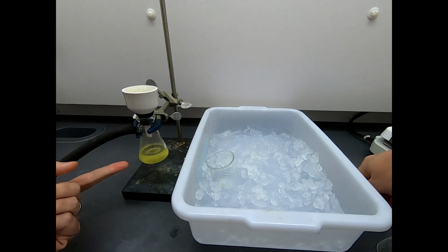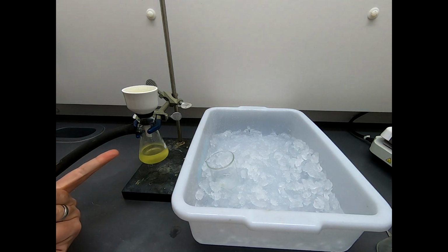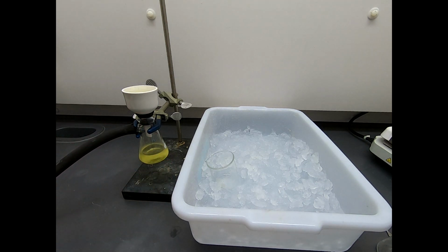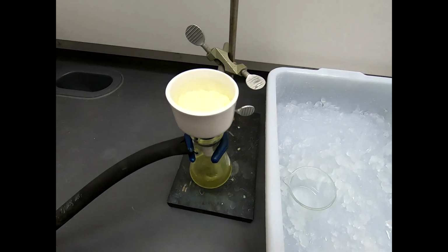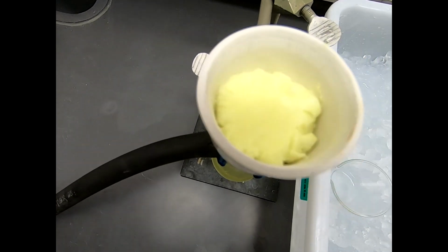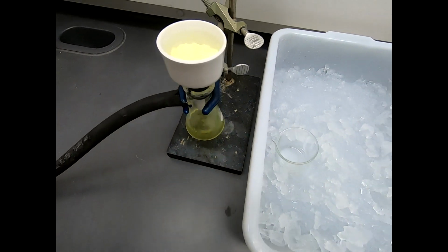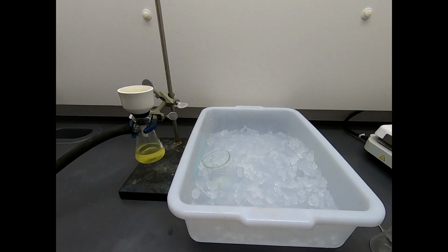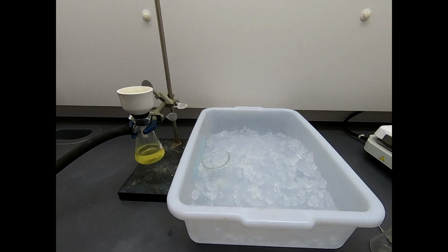Now, as you can see, there is some yellow color down here. And that yellow color, it could be that our product is yellow and we've lost a little bit. You always lose a little bit of product in recrystallization. We can't avoid that. But let's go ahead, take a peek down here. So that's a pretty nice looking filter cake. I could have smushed it against the edges a little bit better, but that's not terrible. So now I'm going to leave this on the funnel. I'm going to let that dry, and once it's dried, we'll put it on a piece of weighing paper, and we'll find out what our recovery is for this recrystallization.